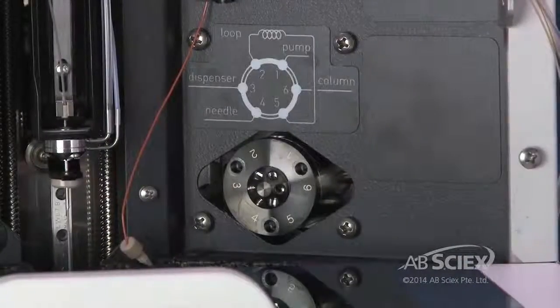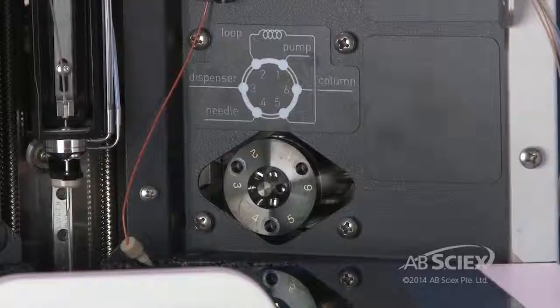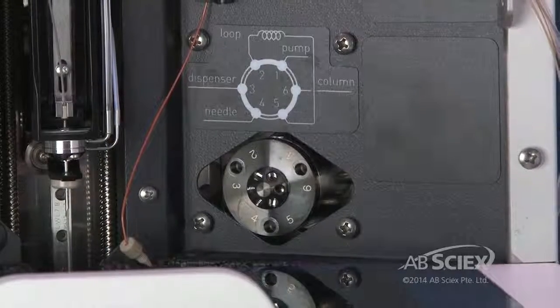Align the stator so that the bolt holes align with the pins on the valve body and press the stator onto the valve body.